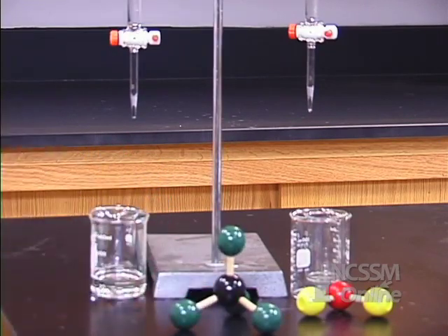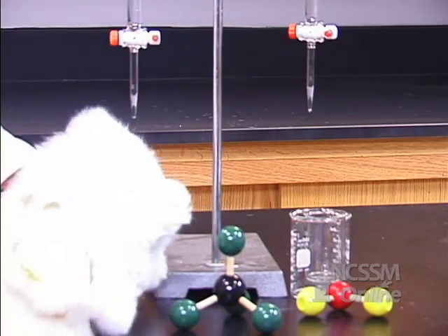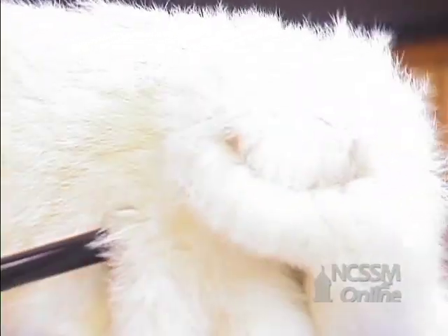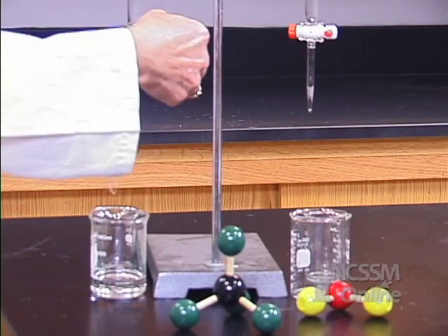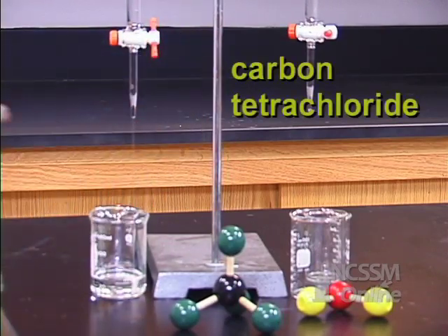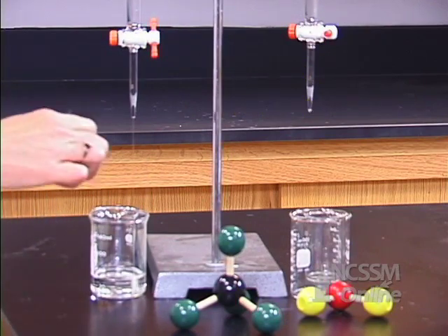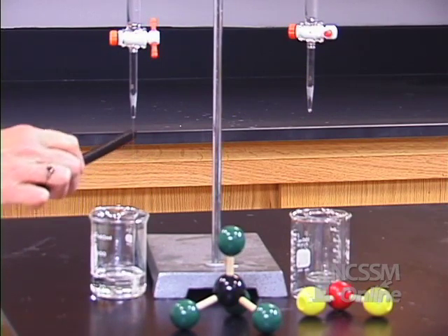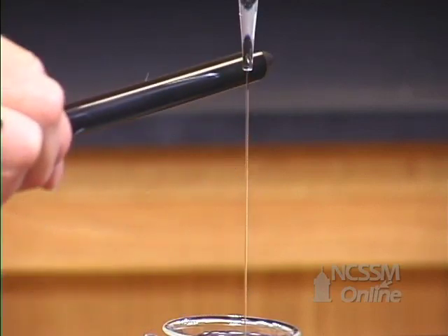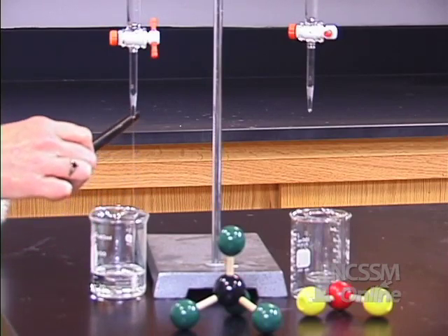I have an ebonite rod, and I'm going to rub it with this rabbit's fur and collect some charges on it so that I have a static charge. Then I'm going to have a stream of carbon tetrachloride, and if this is polar, this charge on the rod will cause it to bend. You can see that this charged rod has absolutely no effect on that stream.